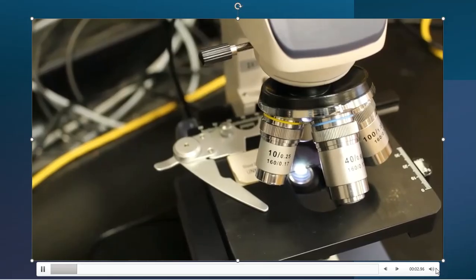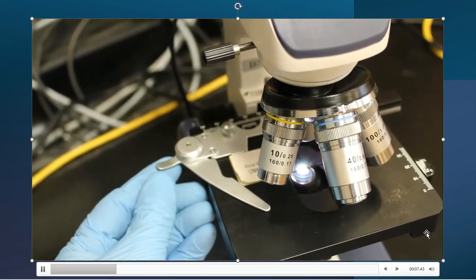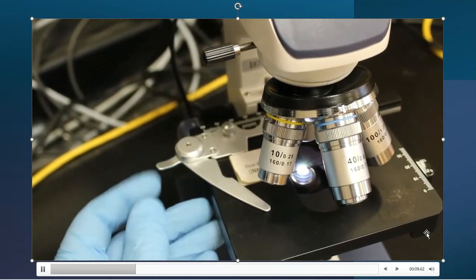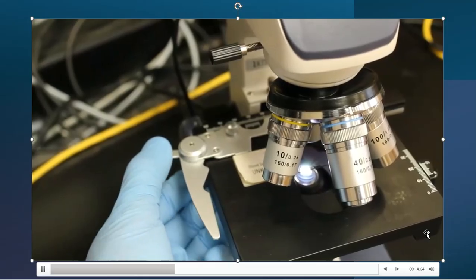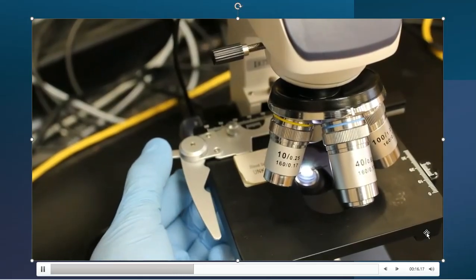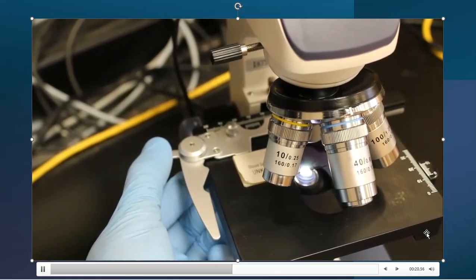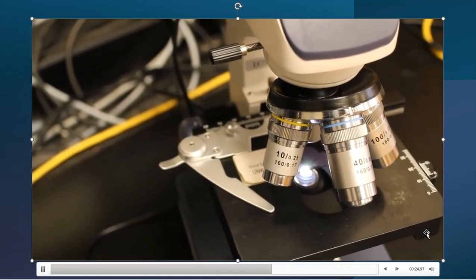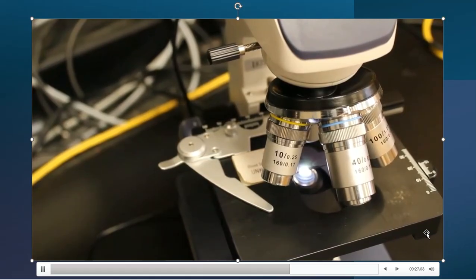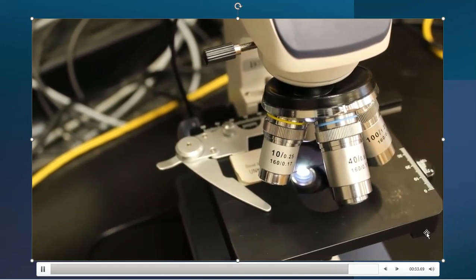This is the other side of the microscope that you didn't get to see a while ago. This is the clip that I keep referring to on the left-hand side. If I just push my thumb against that clip, that will open up the platform and give room for the microscope slide to fit in there. Once I get it nice and snug in the other corner, I just let that go and it rests against the corner of the slide and secures it, so that it does not move around on me. So that's the clip for your microscope slide that I've referred to in the other videos.